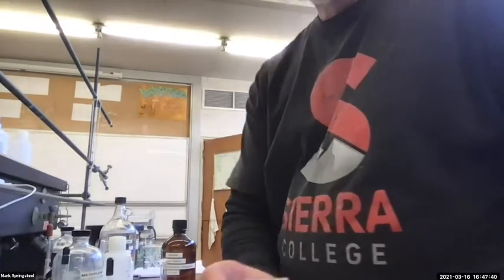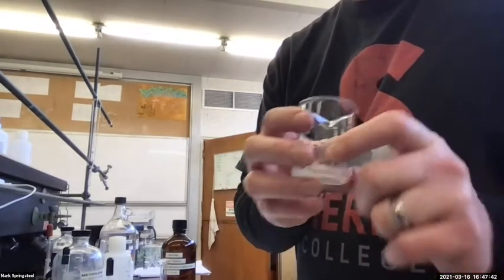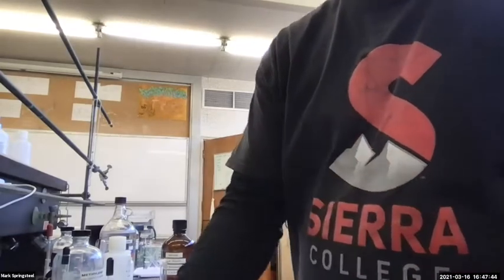Okay, the next thing I'll do is I'll get an IR of it. Let's see if it is actually benzocaine. Let's go back to the IR.